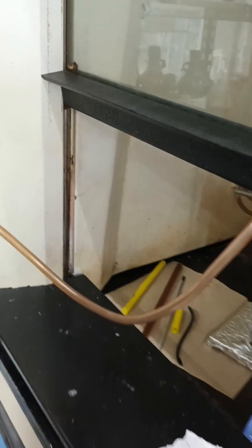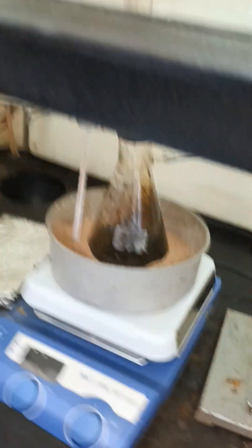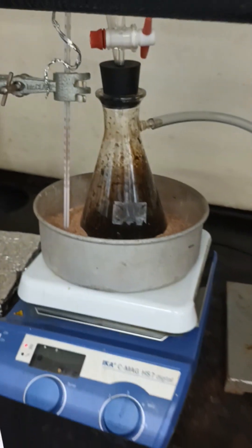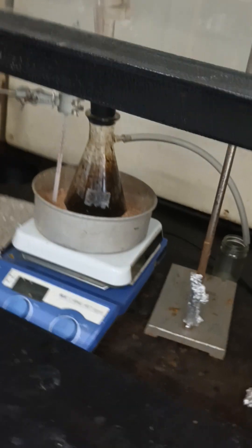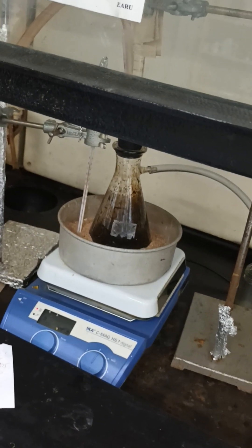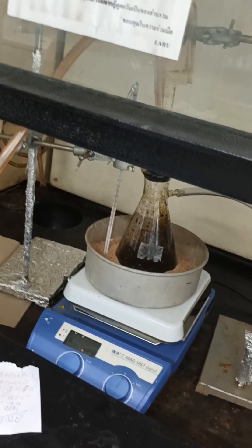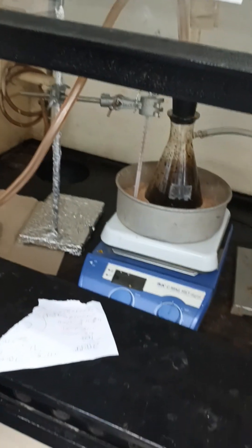Before contact with the base, we purge with nitrogen because it can remove the oxygen from inside. Then after that, you can produce the pure magnetite — almost 100%. It's black. That's perfect. Guys, that's the magnetite after it is synthesized — it produces what you call the black color.